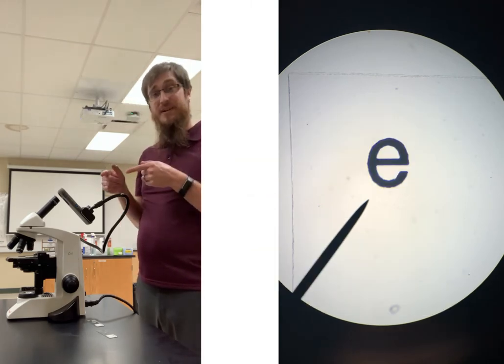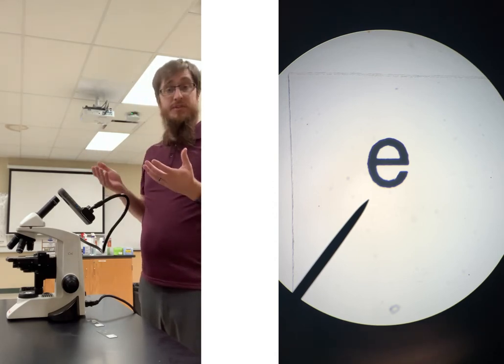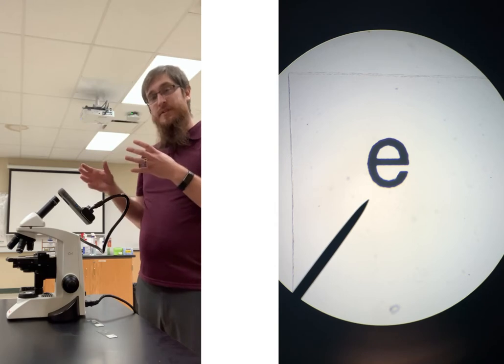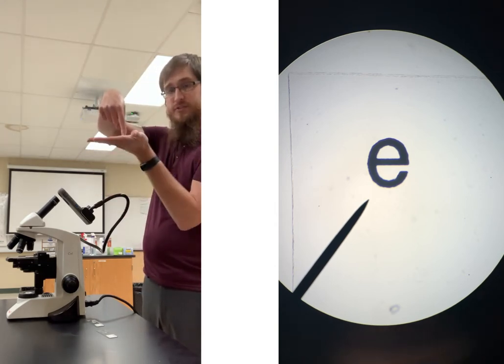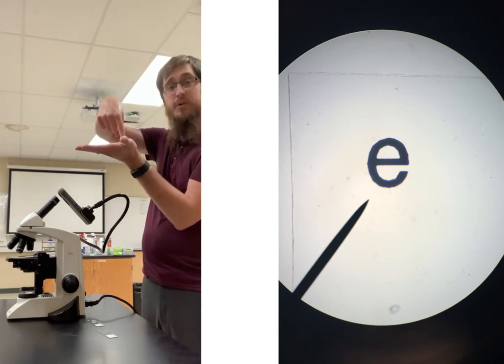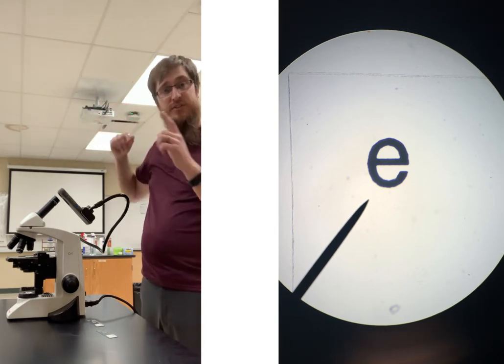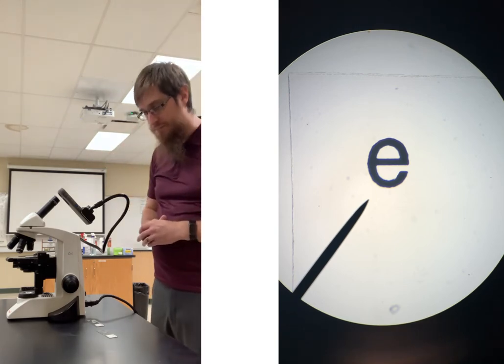Now, going back to our letter E. When we're looking at it here, the E looks correct. That's because all images are inverted and flipped when we look at them through the microscope. So it's just a little thing to pay attention to. Another thing to pay attention to is that if we have a field of view coming down, and this is our slide, if I move my slide forward, it looks like I'm going backwards. And if I move my slide backwards, it looks like I'm going forward. So whenever you're moving the slide, you're actually moving it the opposite direction of what you see. That's just another little thing to keep in mind.